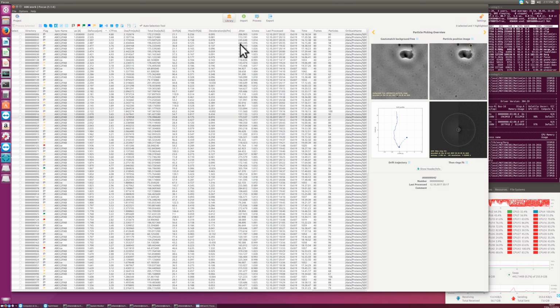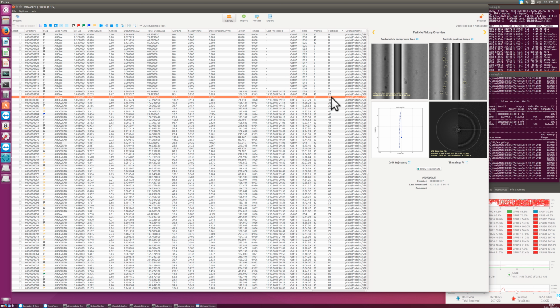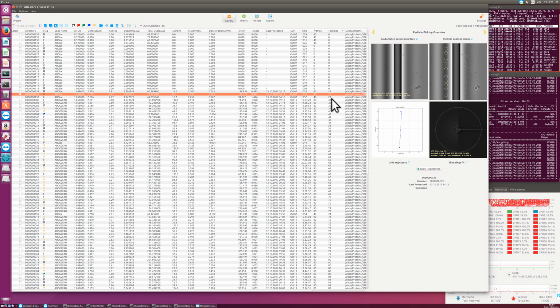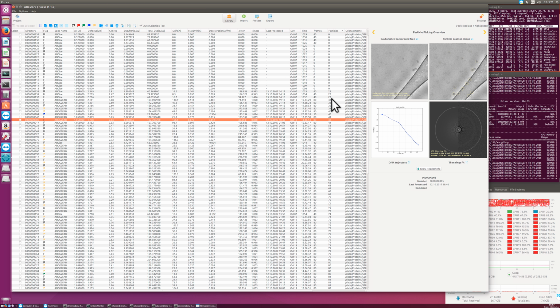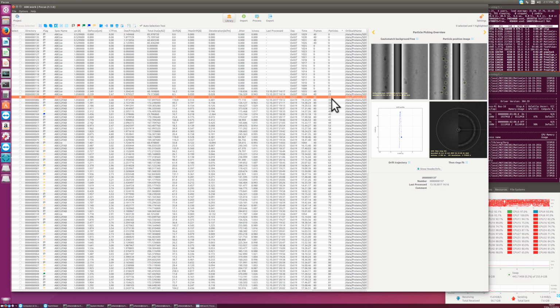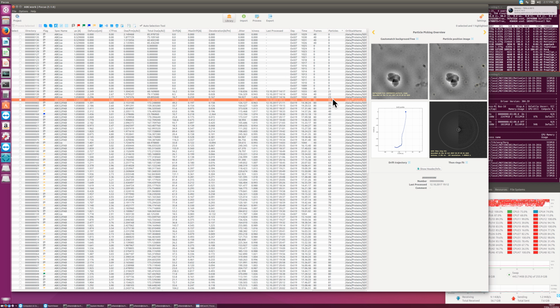Here's particles. So there's the numbers of particles that are found in an image. You can sort by this. So this image here has found only 20 particles, and these are images that we probably best move into the trash. Also, there's obviously a camera problem. One of the analog digital converter boards at the K2 seems to have had a hiccup. But after that it worked again.